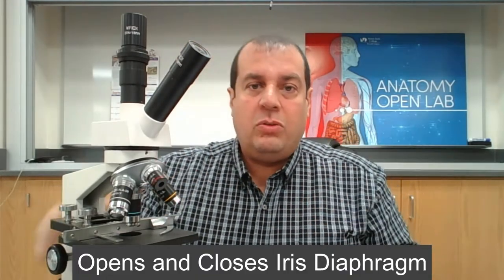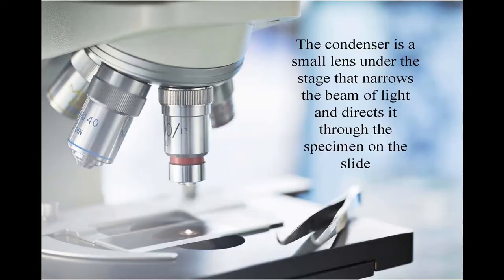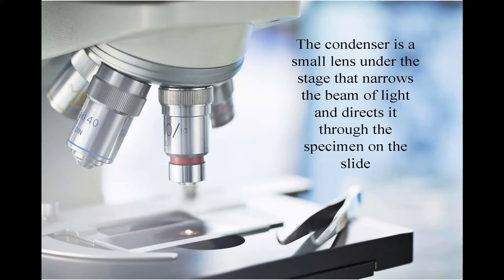This is the iris diaphragm lever. The iris diaphragm lever will allow more or less light to go through. When you go left and right on the iris diaphragm lever, it opens and closes the hole to allow more or less of that condensed light to go up. We also have the condenser — a small lens under the stage that narrows the beam of light and directs it through the specimen on the slide.